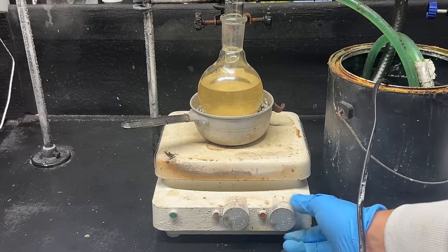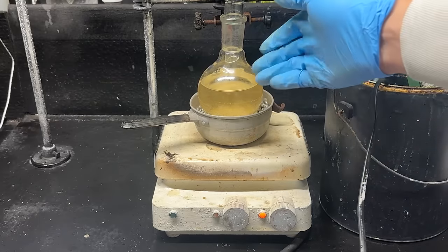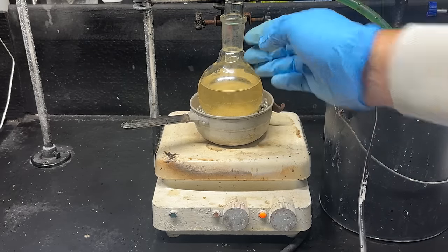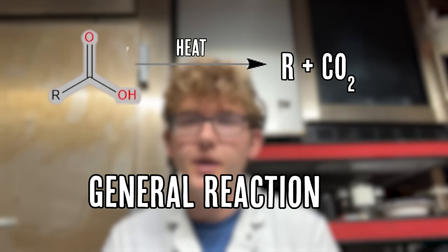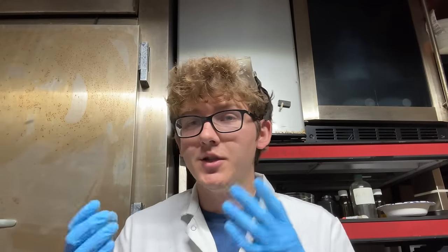Now we just have to apply high heat. We're aiming for this reaction to get to around 150 to 165 degrees Celsius — it'll pretty much maintain itself with the reflux we have going. We're doing a ketone-catalyzed decarboxylation, which also requires high temperatures to push that decarboxylation along. We're essentially taking the carboxylic acid hanging off our L-histidine molecule and removing it using heat.